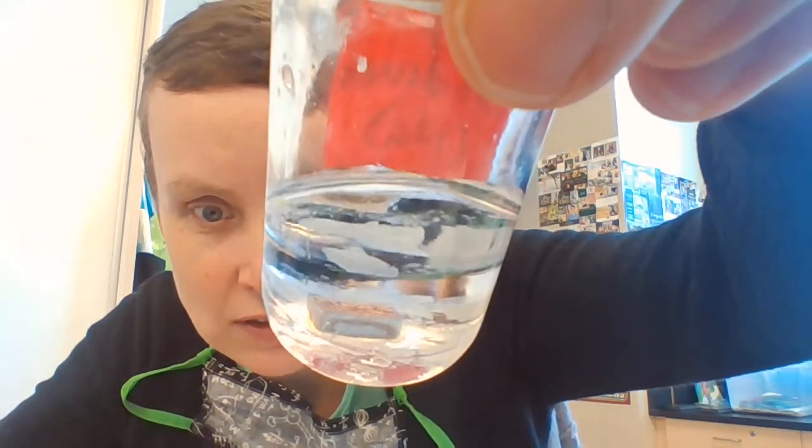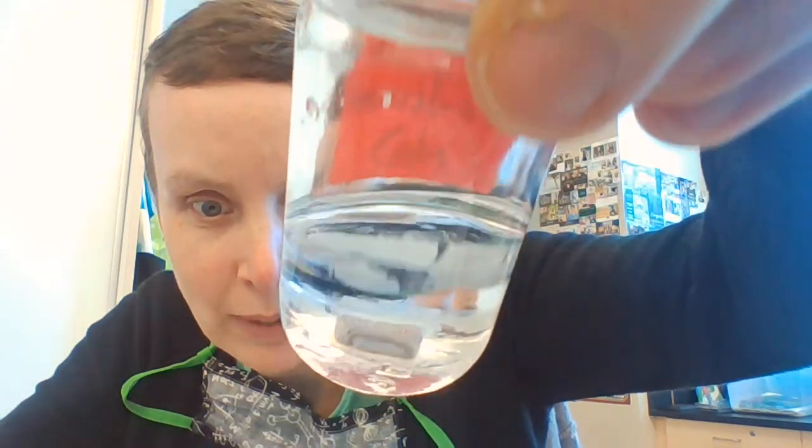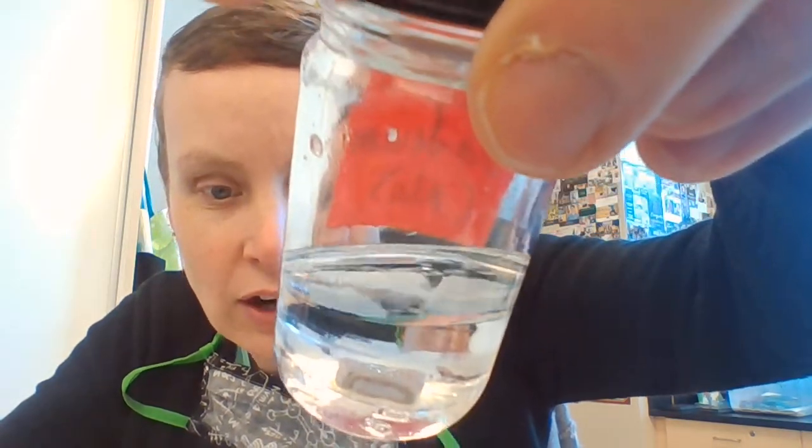There's the top of it. You can see it kind of reflects that red from the label back at you. But it's a very shiny silver metal. And if we were to take it out, which I don't necessarily want you to write this because we're not taking it out, so you can actually see it for yourself, but it's very, very soft. I could cut it with a butter knife.